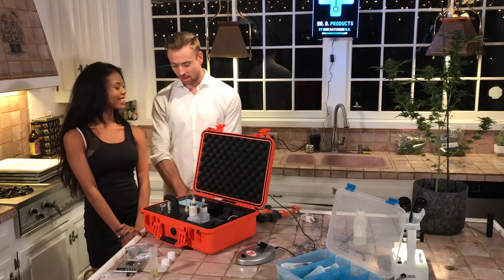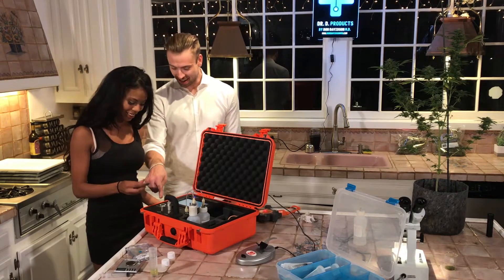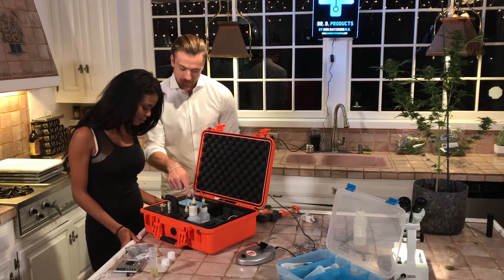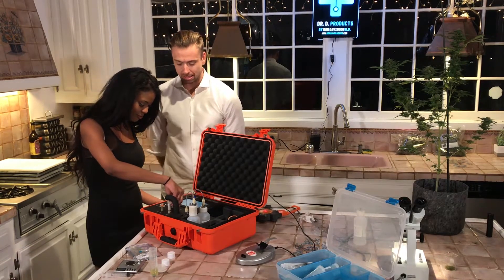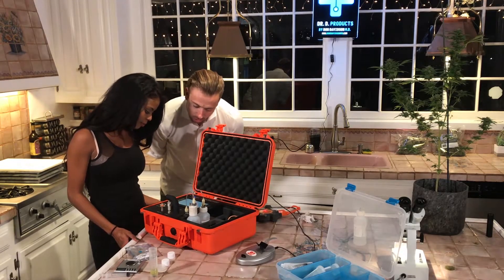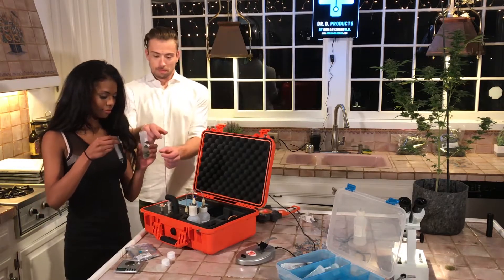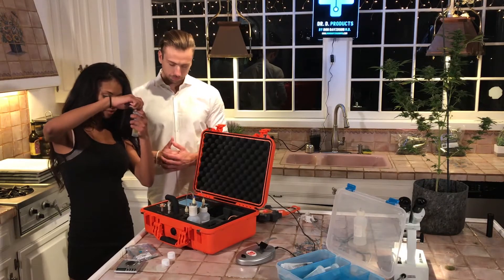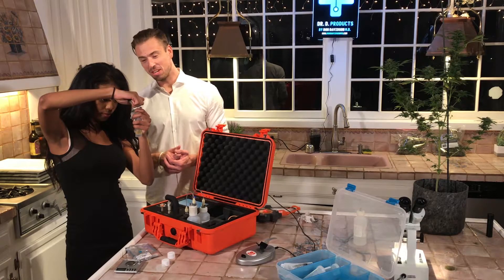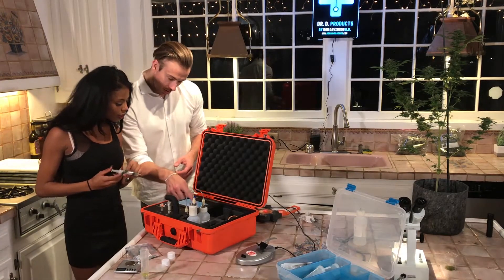We're back. The machine tells us to install the syringe filter and connect it to the port. Go ahead and install that right there — perfect. Press next. It says set to load, so go ahead and turn this dial to the green light that says load. Then press next. Step three: fill the syringe with two milliliters of your extracted sample. Grab the vial in your left hand and the syringe in your right. Insert it in there and suck up about three milliliters. Good job.